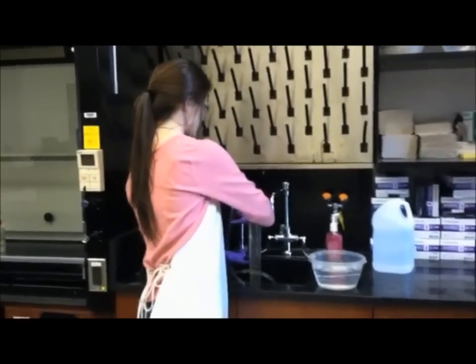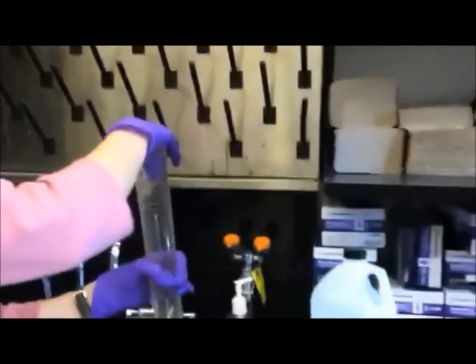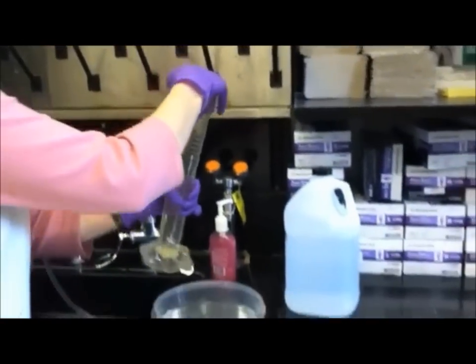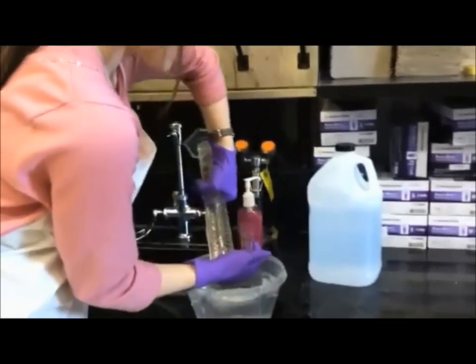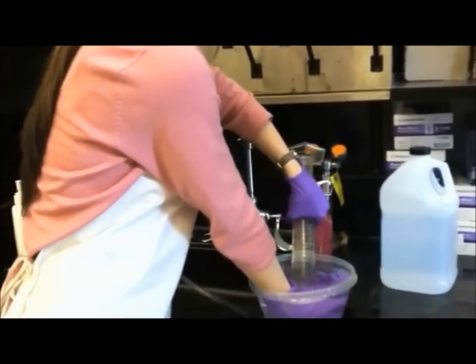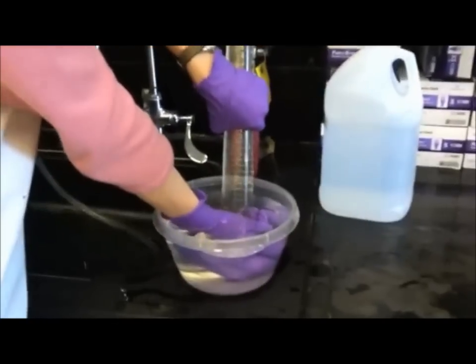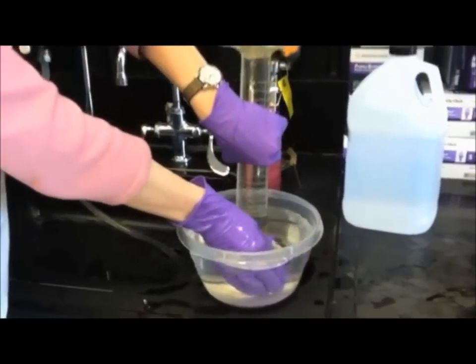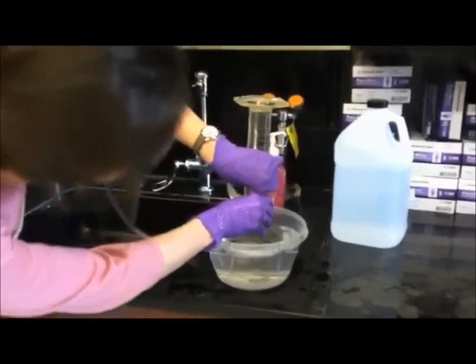Once the graduated cylinder is full, you'll place your hand on the top and secure it. And then flip it very carefully and make sure that the nose of the graduated cylinder is underneath the water in the water bath. And then you will remove your hand very carefully, not to get any air bubbles in.